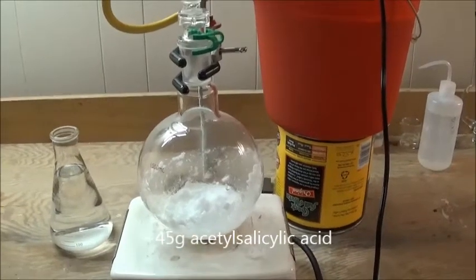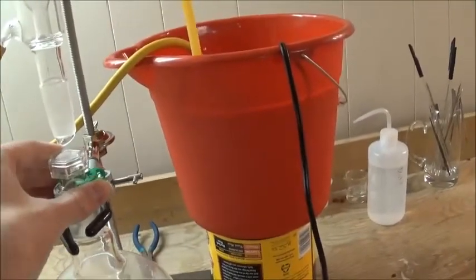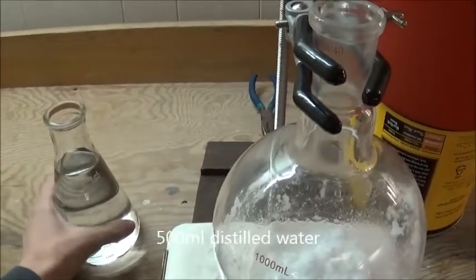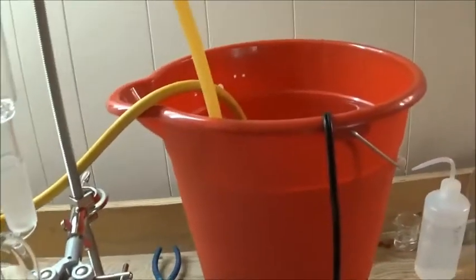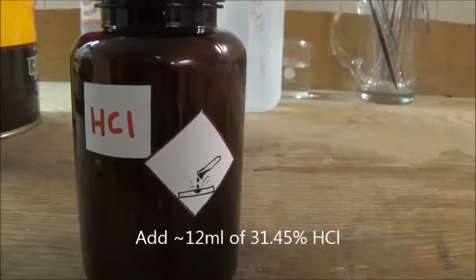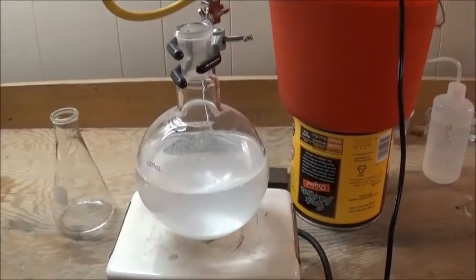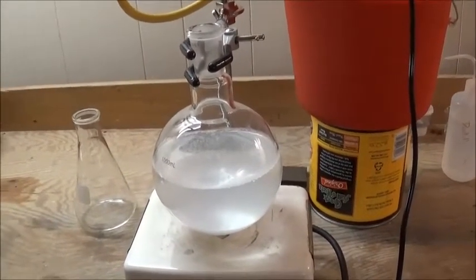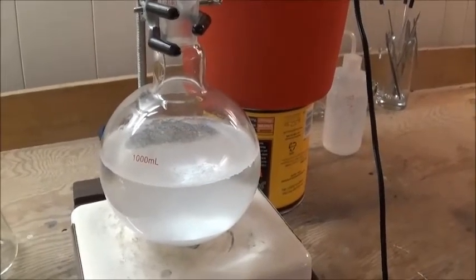I have already added 45.22 grams of ASA to a 1 liter round bottom flask, and in addition to this we're going to require some water. I have approximately 500 milliliters here. The amount doesn't need to be that precise, but close to 500 milliliters will be okay. Now it's time for the acid catalyst, which is hydrochloric acid. I just added the hydrochloric acid — it was approximately 12 milliliters, and I diluted it with about 100 milliliters of water to keep it from fuming in the lab. That makes a total of approximately 600 milliliters of water added and 12 milliliters of hydrochloric acid.